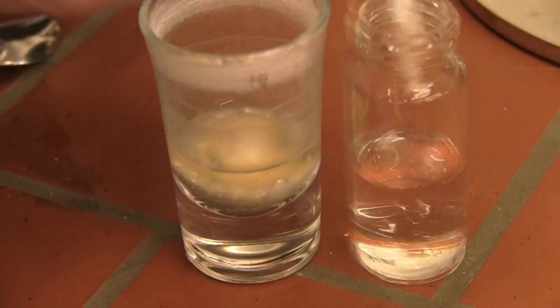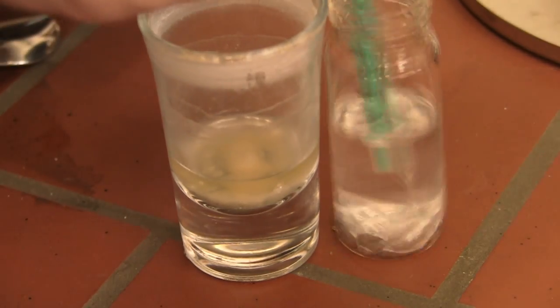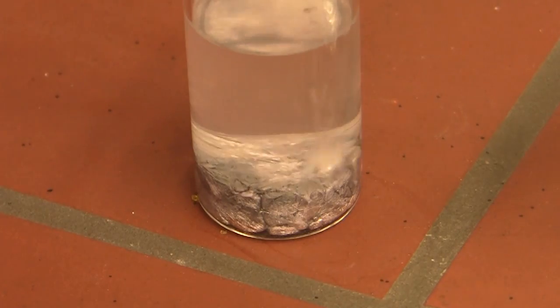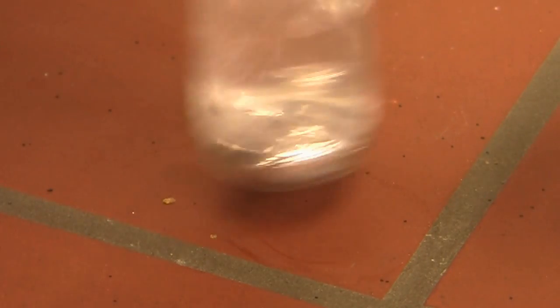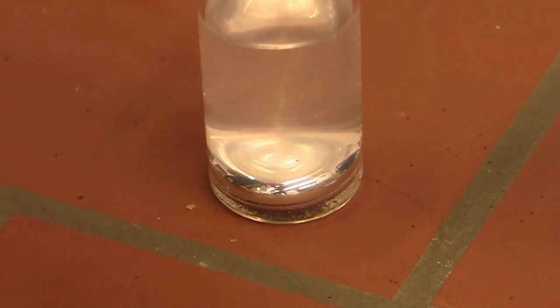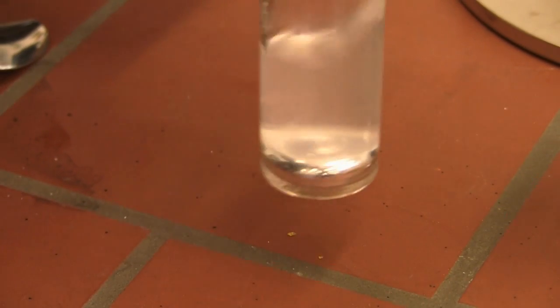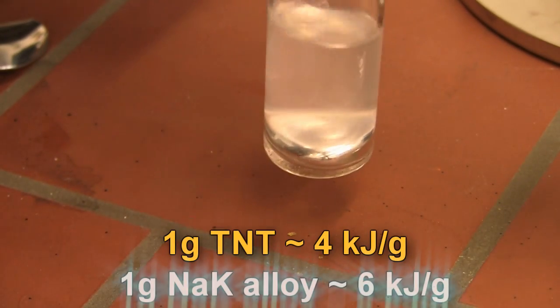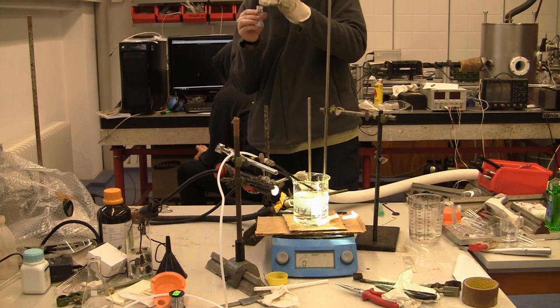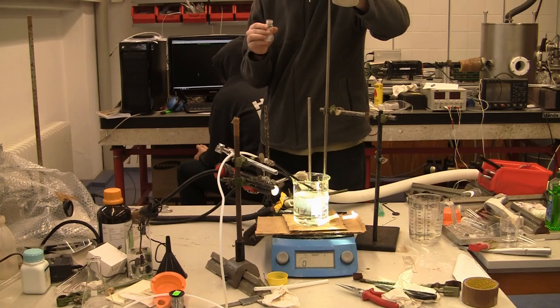The beautiful thing is when you actually take this alloy out — okay, it looks fairly ugly at the moment — and then you add a single drop of ethanol or similar alcohol, and you get this beautiful, clean surface. It really is just the most beautiful shiny metal. However, this really is Beauty and the Beast, because when this metal reacts with water it's actually more energetic than when TNT explodes. This is what I mean — this is a single drop of sodium-potassium alloy reacting with water.